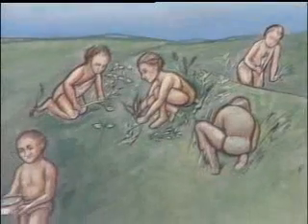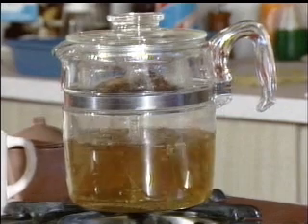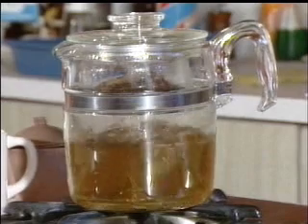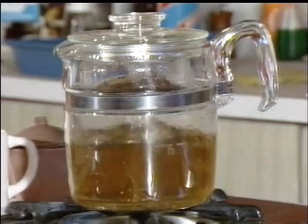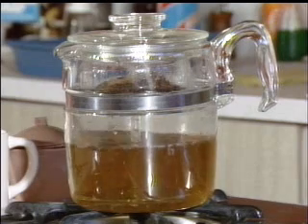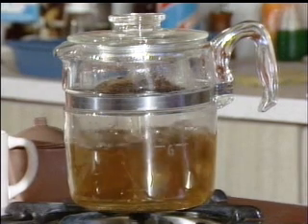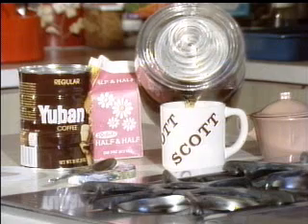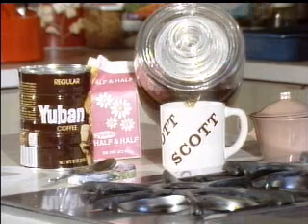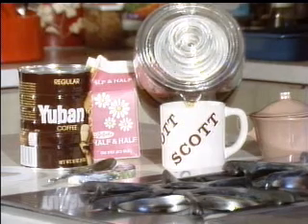Down through the ages, people have gathered herbs and boiled them to extract their flavor. Even today, a simple everyday example of extraction is the coffee pot. Boiling water percolating through the freshly ground coffee beans extracts from the beans the oils and soluble compounds that produce the well-known flavor of a cup of coffee. This example involves the exchange of material from a solid, the ground beans, to a liquid, the coffee.